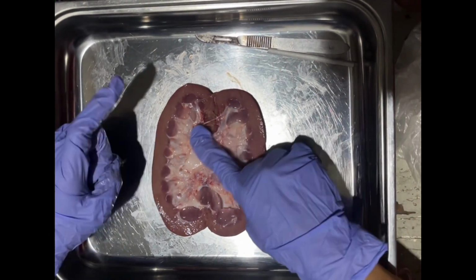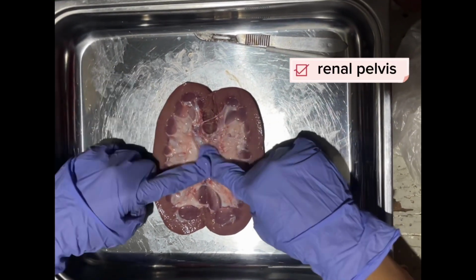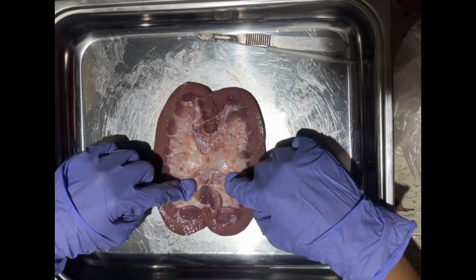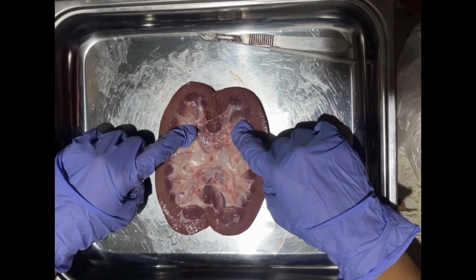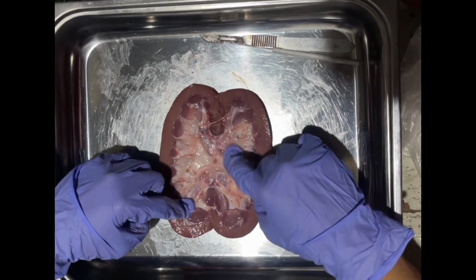And lastly, this hollow part in the center of the kidney is the renal pelvis. The collecting ducts drain into the pelvis. From there, the urine passes out through the ureter to the urinary bladder.